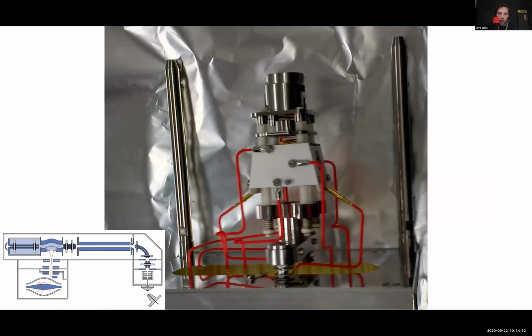So this is the C-trap, and this is now viewed from the top. So the ions come in this direction. You fill up the bucket. When it's full, you eject them out here. Or if you want to fragment a selected ion, an ion that you've selected in the quadrupole, then you can pop it out the side there to the HCD cell, which looks like this.